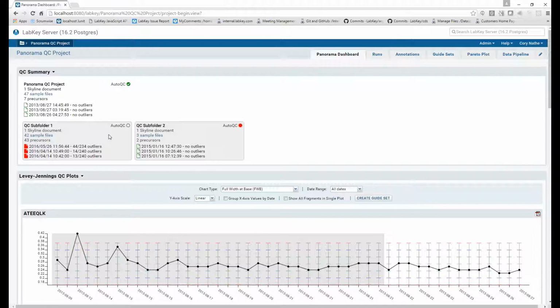And you'll see there are 3 different statuses, and I have an example of each one shown here. When I hover over the status, it tells me in the green state, the active state, the last time this container was pinged by AutoQC. When the most recent ping happened greater than 15 minutes ago, that status turns to red. So you see here this container was last pinged several days ago, as an indicator that the ping hasn't happened very recently. And then finally there's an indicator of a container that has never been pinged by the AutoQC tool.